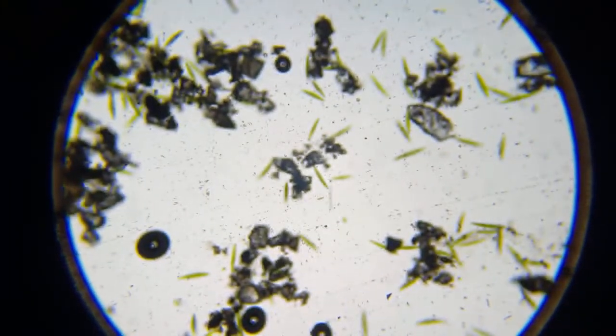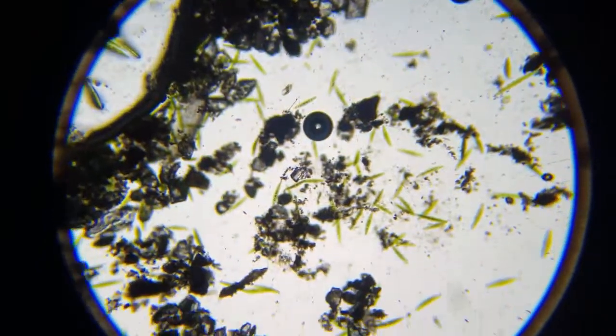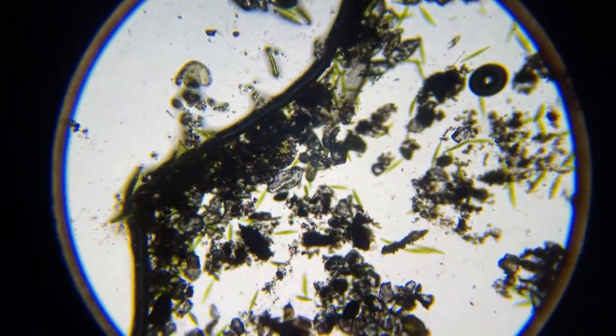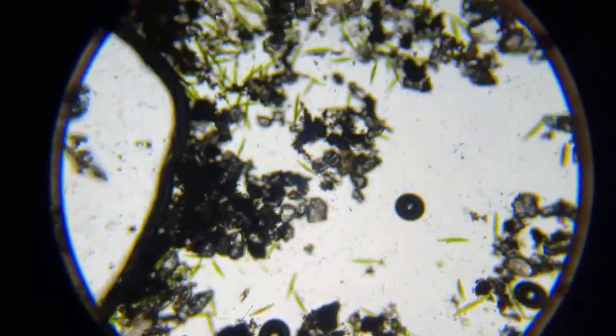I didn't know he was on here. Mainly what I have on here is a Dileptus, and that's what I was trying to stream, if I can find him again.